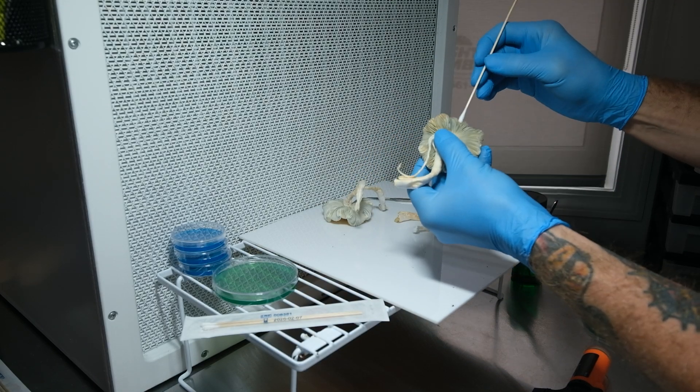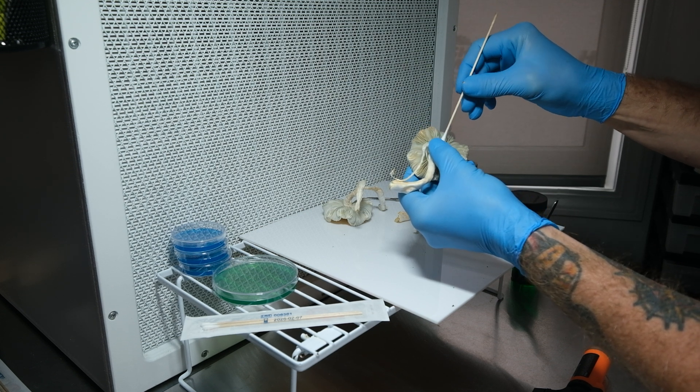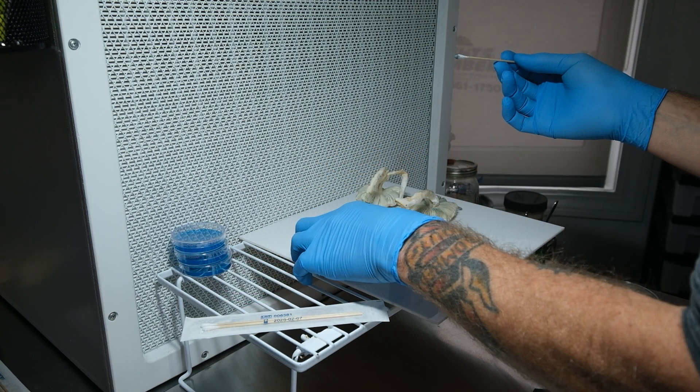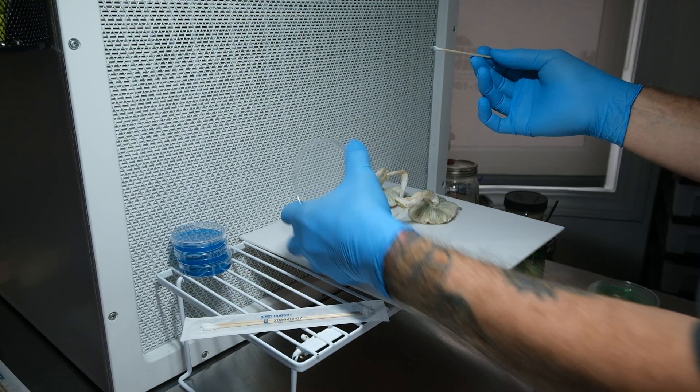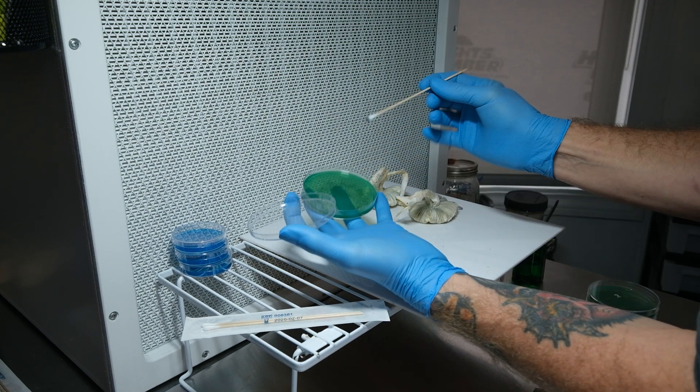Now we're going to take some spores. I've verified on a microscope that there are spores in here so I'm gonna go ahead and swab these gills.